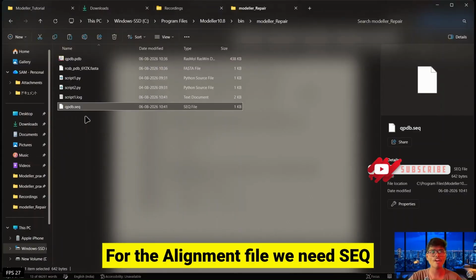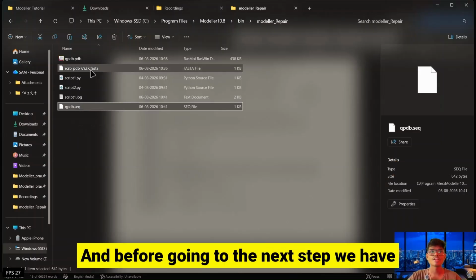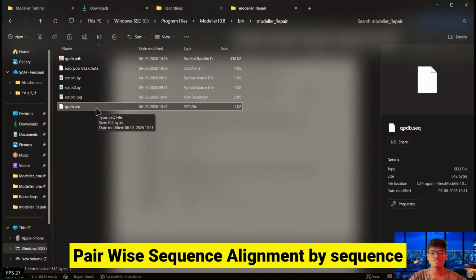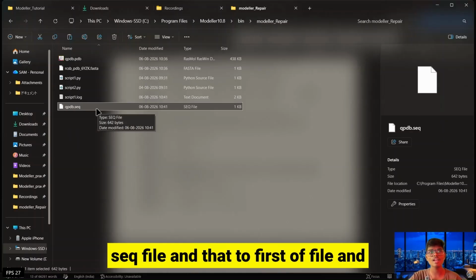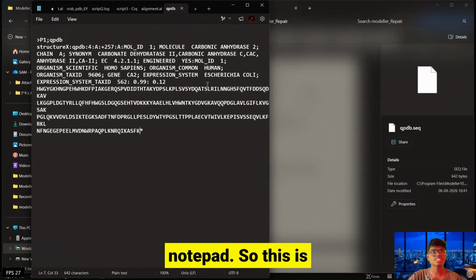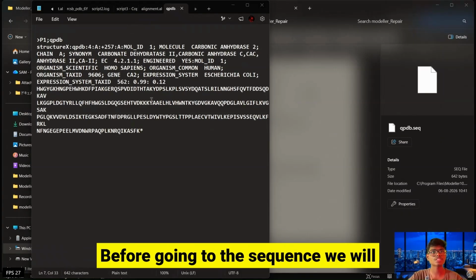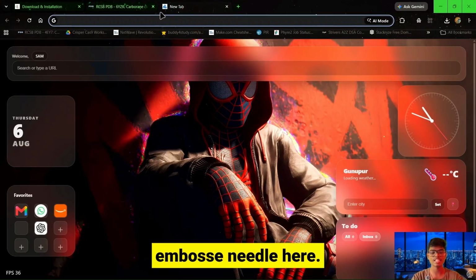For the alignment file, we need the .seq sequence and the FASTA sequence. Before going to the next step, we have to use the website EMBOSS Needle for the pairwise sequence alignment. For that, we also need the .seq file and the FASTA file. Let's open the seq file using Notepad. So this is the .seq file. We need the sequence. Before that, we will go to the browser and search for EMBOSS Needle.